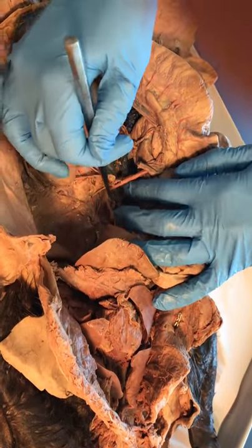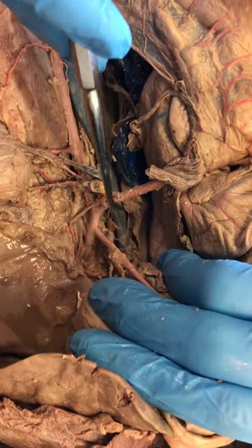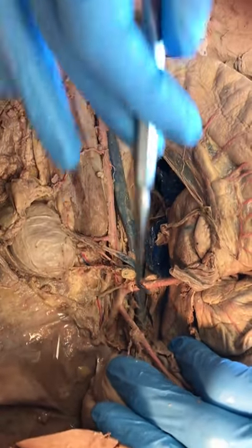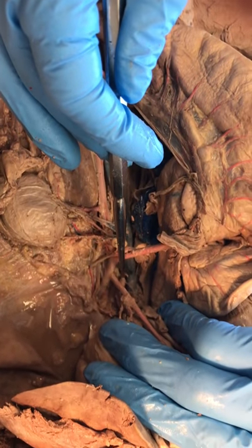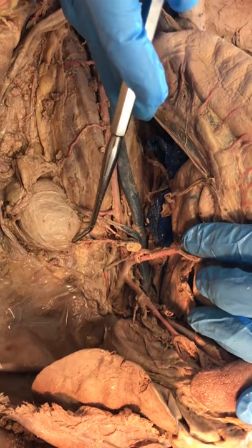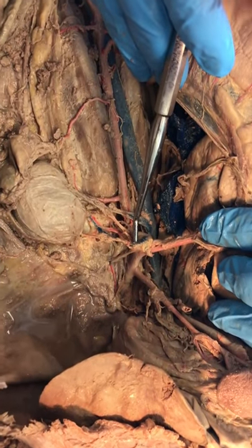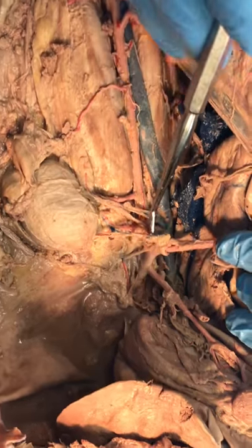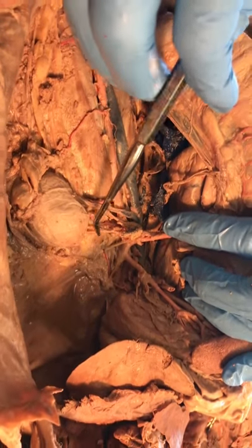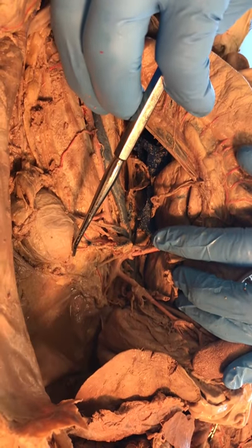The first vein we need to identify is the largest one — it is the post cava. The post cava continues all the way down the body, similar to the abdominal aorta, so the post cava is here. The first branch off the post cava is this little guy going to the top of the kidney where the adrenal gland would sit, so the first vein you see is the left adrenal lumbar. The right adrenal lumbar is hidden, so we'll just look at the left adrenal lumbar. If it's headed towards the adrenal gland on top of the kidney, it is the adrenal lumbar vein.